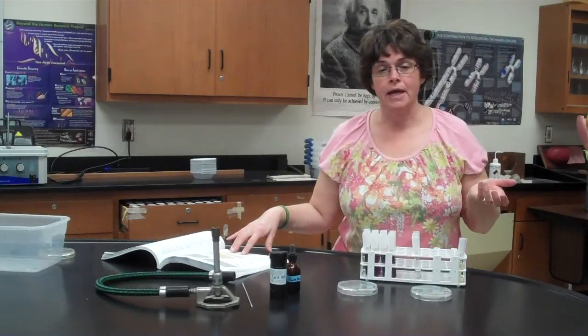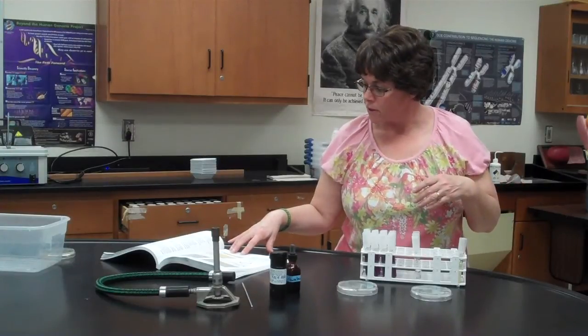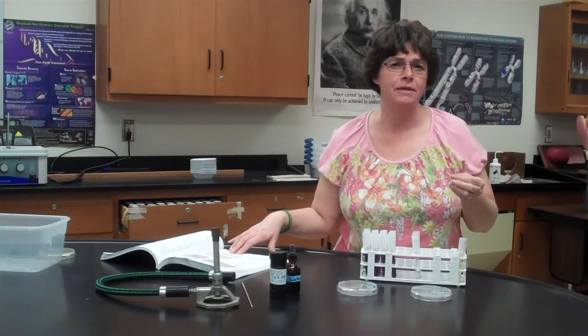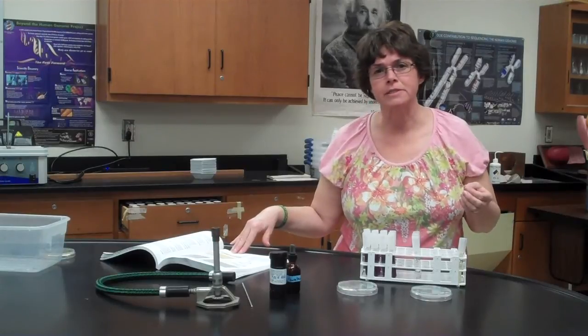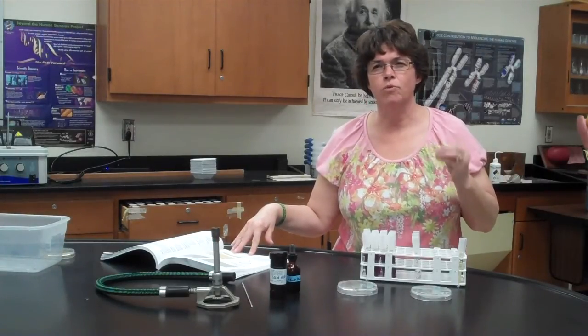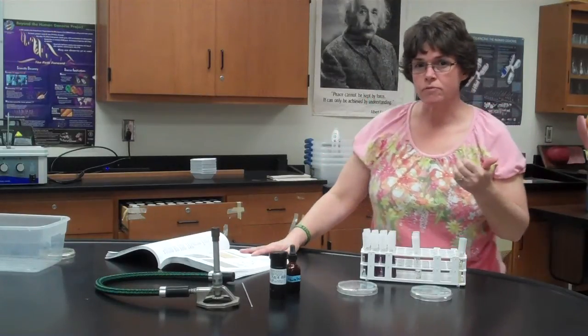We're going to use Candida albicans, which is the cause of yeast infections. We're going to use Rhodotorula rubra, and rubra means red, so these actually have a pink color to them. And the last one is the Schizosaccharomyces octosporus, and this one is more white in color and it can look a little bit fuzzier than the regular yeast does. Okay, so we're going to look at those four. We do not have the fifth one.